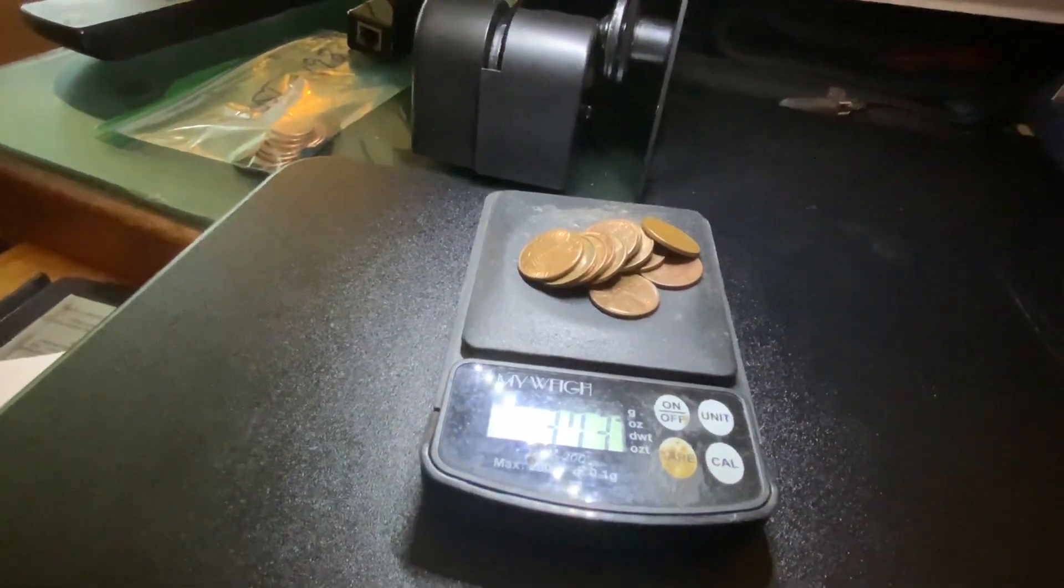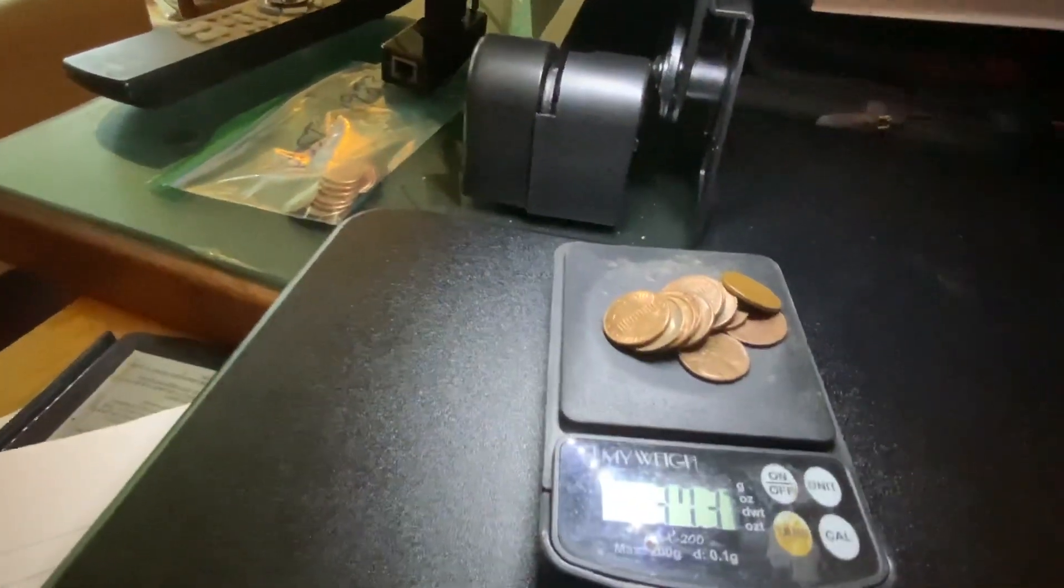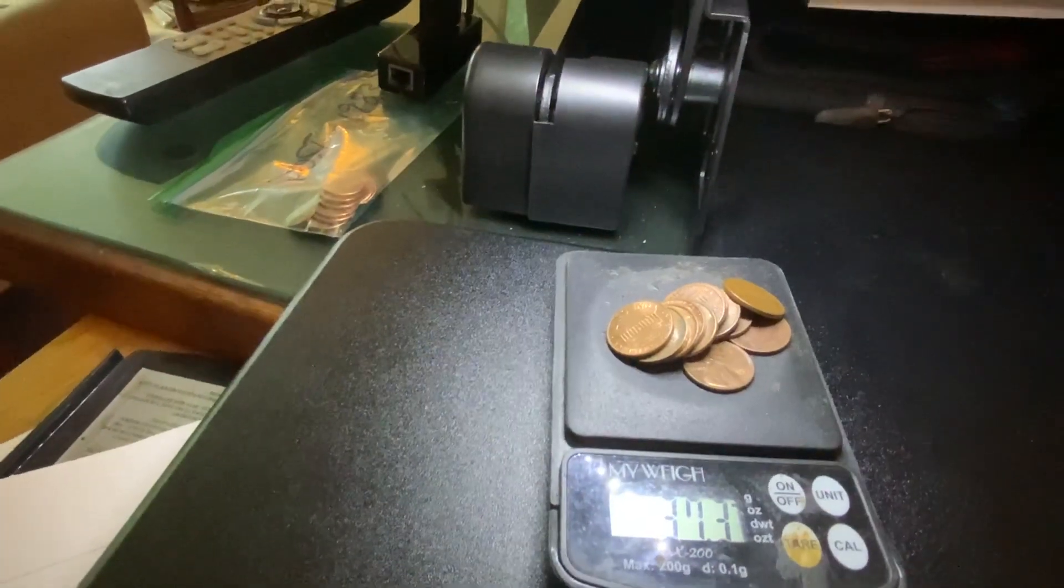Now I'm gonna stack my pennies on here. Alright, write down that value, make sure the reflection's not on there.